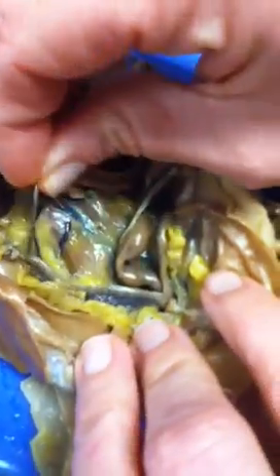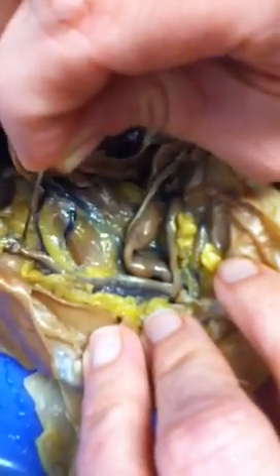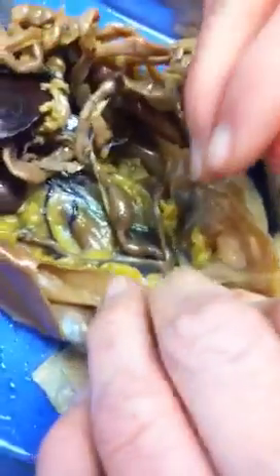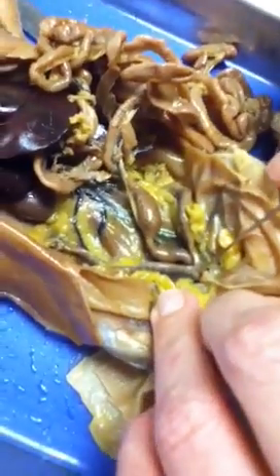These are your uterine horns. This will be your ovary. Attaching your ovary to your uterine horns is your oviduct. And I think that's it. Voila. Wait, what's the vagina and the... Oh, the vagina? The vagina's where they meet. Yeah, the vagina is where your uterine horns are going to meet. They will be right there. I have to go. This one.